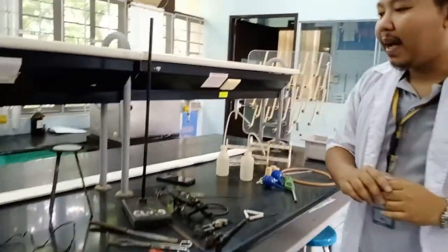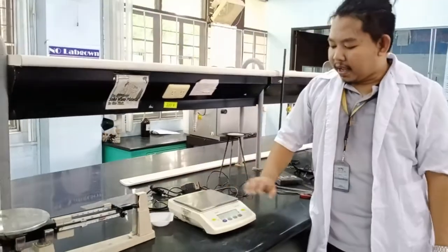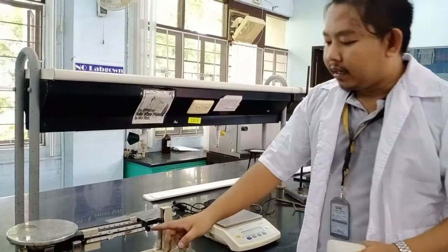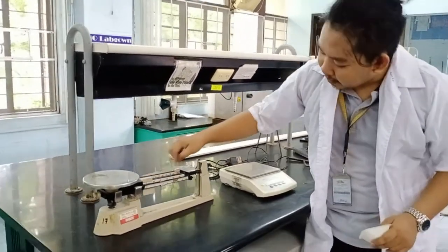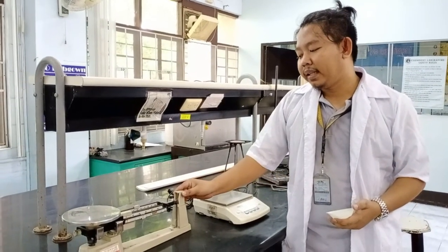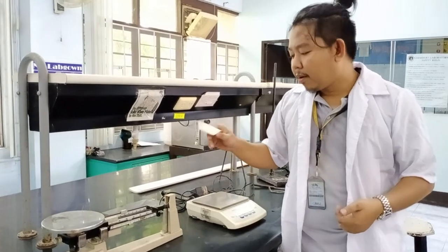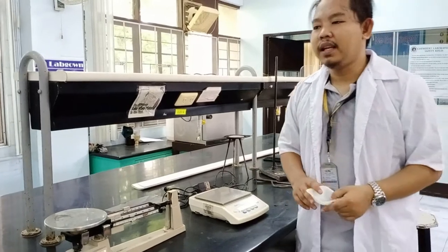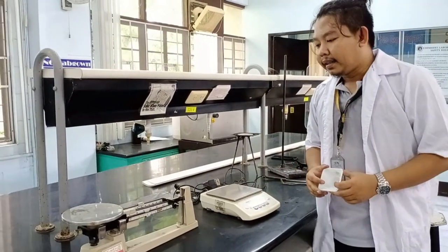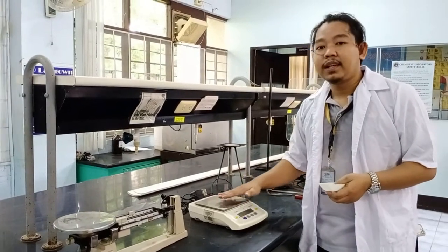And finally, some distilled water. So these are some utility items. And finally, we have other equipment. We have a digital weighing scale — it's more modern. You turn it on and with the most decimal places, you can get an accurate measurement. You can also use the triple beam balance. You'll need to adjust it properly. And then finally, the weighing boat. Some students directly place chemicals on the scale, which is why the digital scale and triple beam balance get rusty. So we place chemicals in the weighing boat first, then subtract its weight from the total.